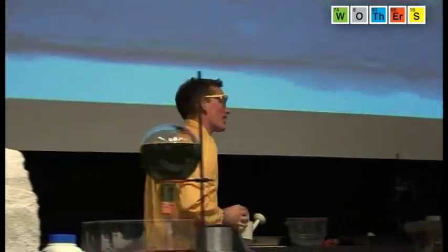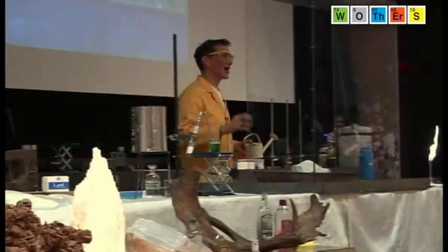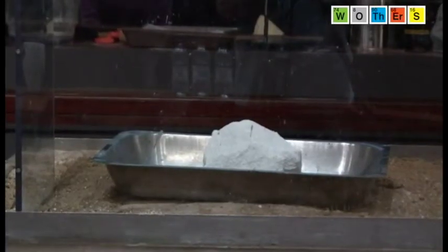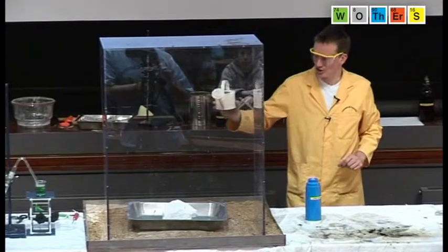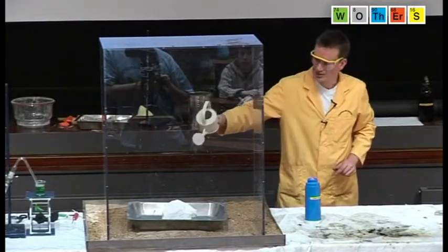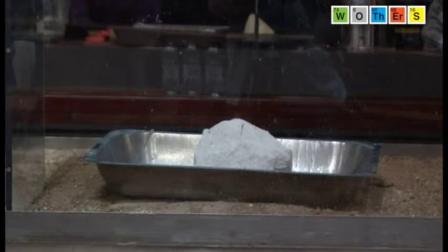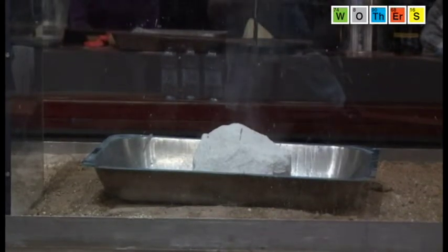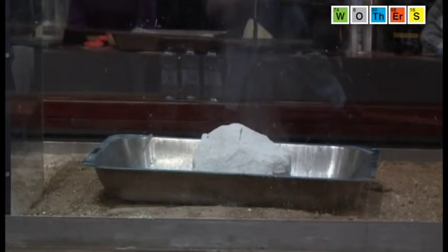But watch what happens when calcium oxide reacts with water. I'm just going to pour some water onto the rock here that's actually now calcium oxide, not calcium carbonate. I've just poured some water on, and steam is being generated.